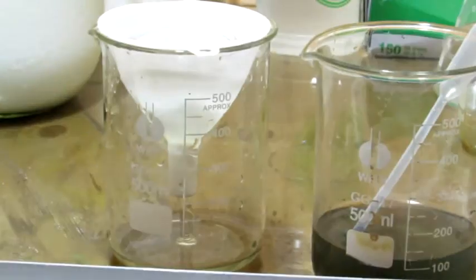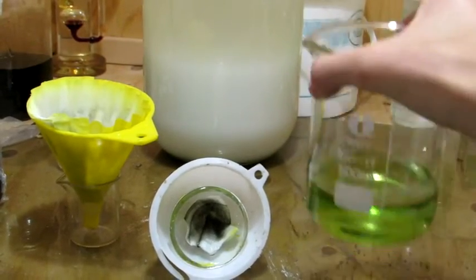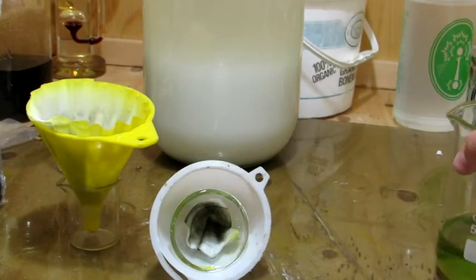This should contain the iron and neodymium chlorides, and we can save this to the side for future projects so we can extract some neodymium from it.